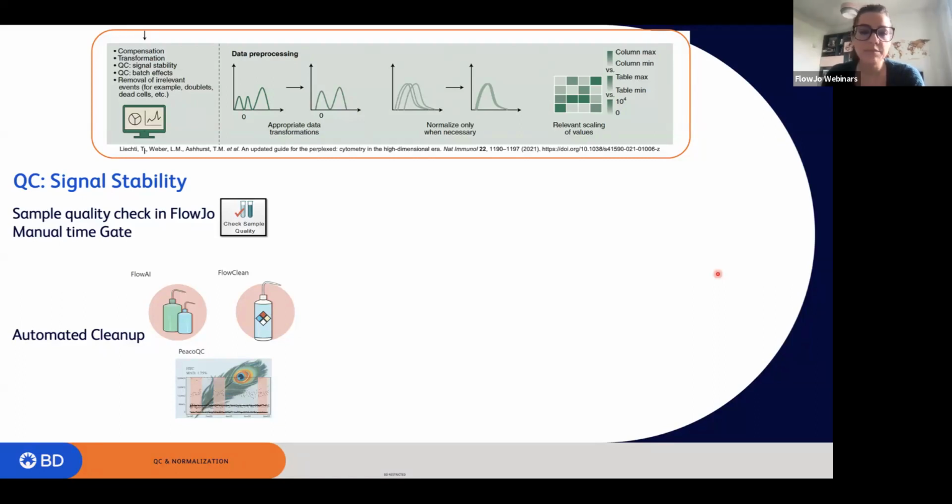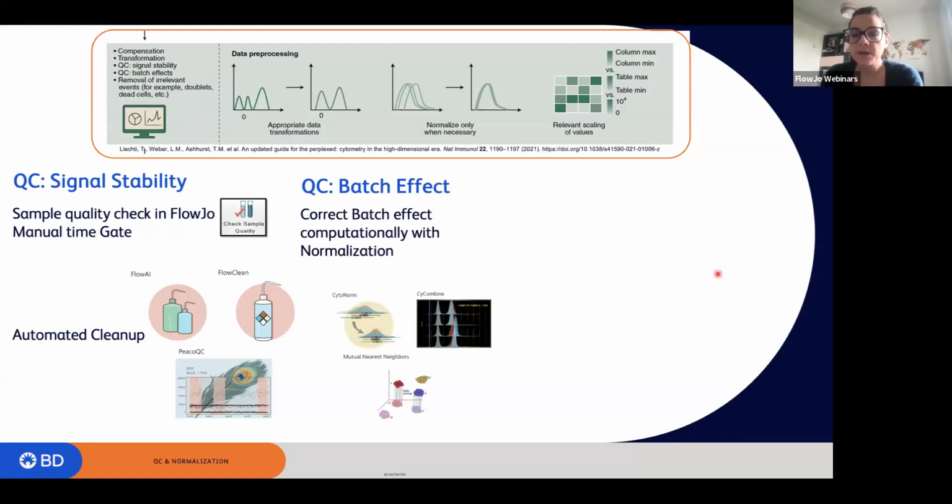So evaluating the signal stability in FlowJo can be done with a default tool, and then followed by manual gating, or with automated cleanup algorithms, okay? In case we are working with batches, we want to evaluate the batch effect and the differences within that. In FlowJo, there are ways you can correct the batch effect computationally with normalization. And you can see right here, I've listed 3 algorithms that I will show you today as cytonorm, cycombine, and MNN. While for quality check, I've listed the 3 algorithms that we have available as FlowAI, FlowClean, and PeacoQC.